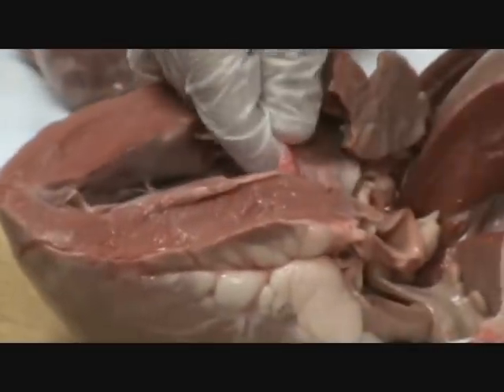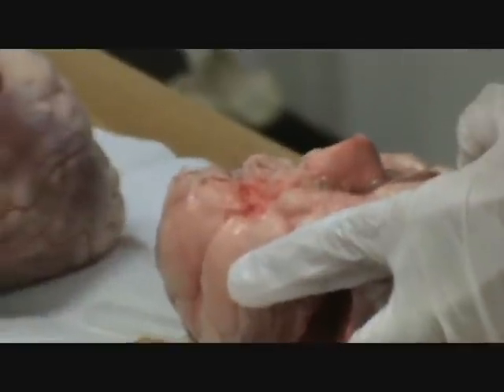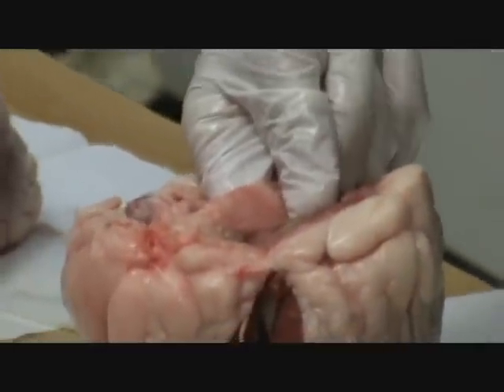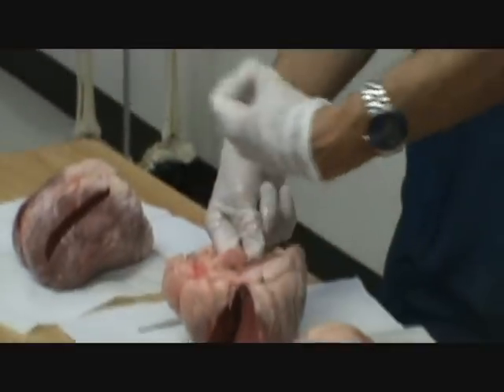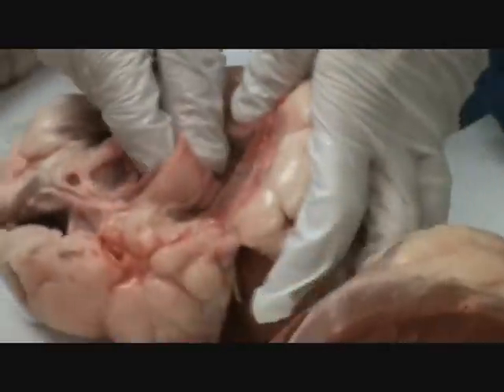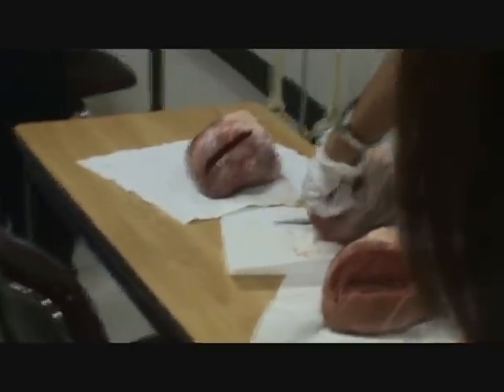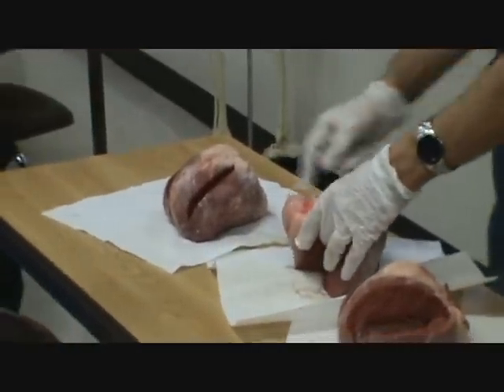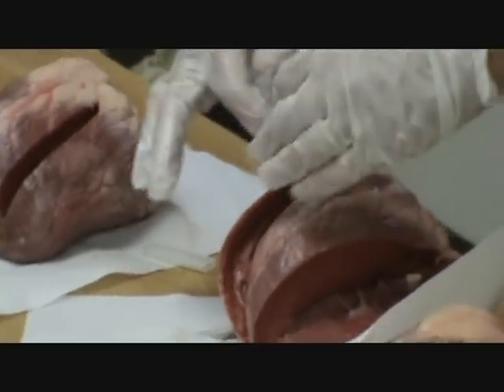This tendon is attached to the leaflet of the mitral valve. Let's close this heart and look at the mitral valve. The mitral valve is located between the left atrium and the left ventricle. The mitral valve forms a leaflet here and a leaflet here because it only has two cusps. When the chordae is pulled on it — when the papillary muscle pulls the chordae tendons, the leaflets of the mitral valve are going to open like this. What's pulling from the bottom? It is a tendon. Papillary muscle contracts, pulls on the tendon, mitral valve opens. Same thing in the tricuspid valve — tendon pulls on the valve when the muscle contracts.